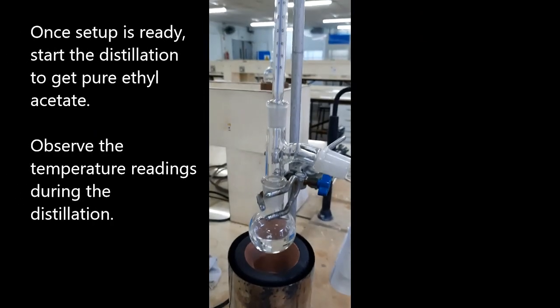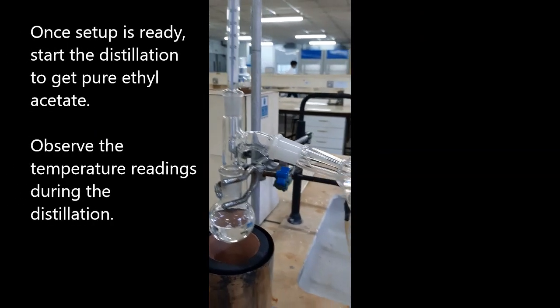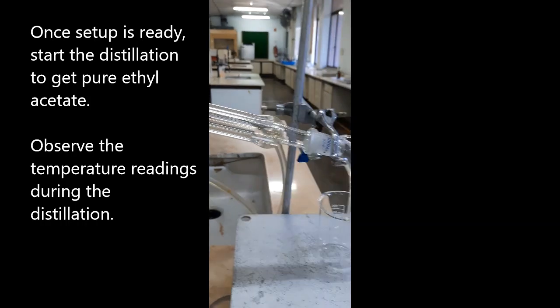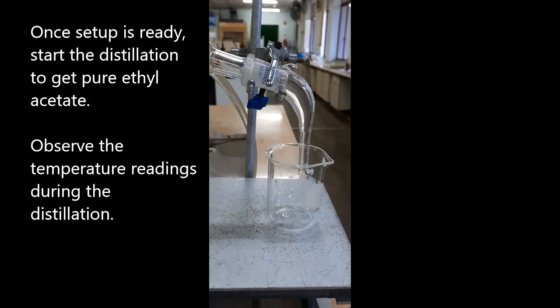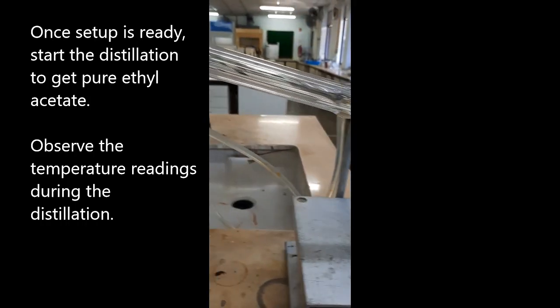Switch on the thermal heater to begin the distillation. Observe the thermometer readings during the process.